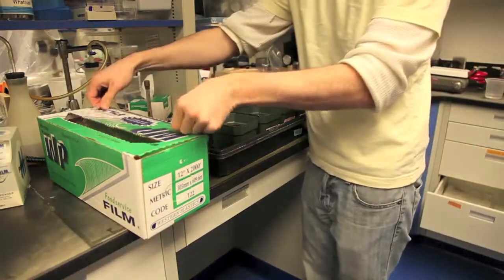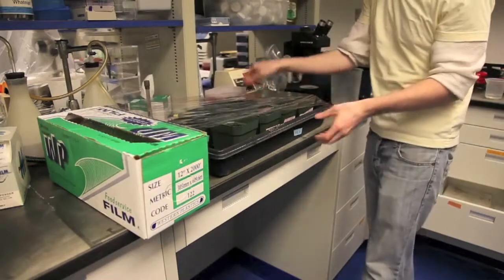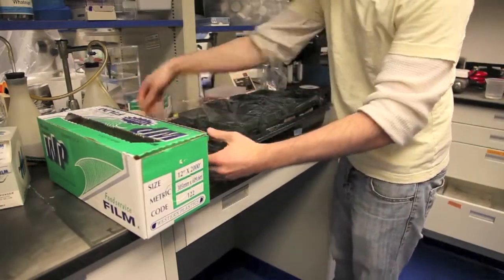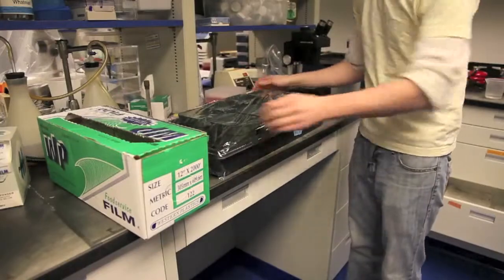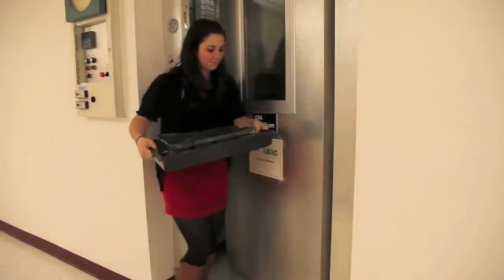Once you're done planting all your seeds, place all the classes pots into labeled trays and cover them with saran wrap. The saran wrap will keep the soil from drying during the stratification step you'll be doing next. Place the trays inside a cold room or refrigerator for at least two to three days for stratification.